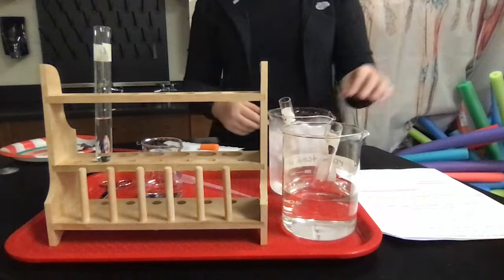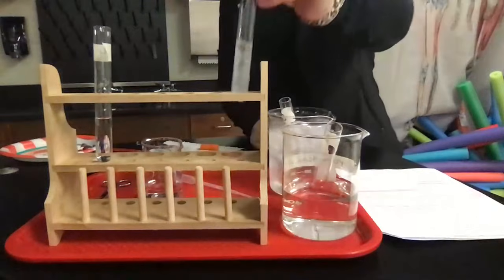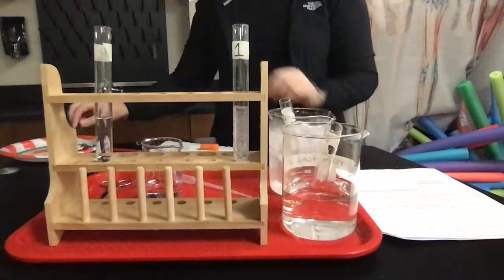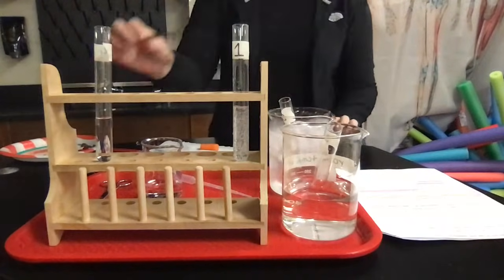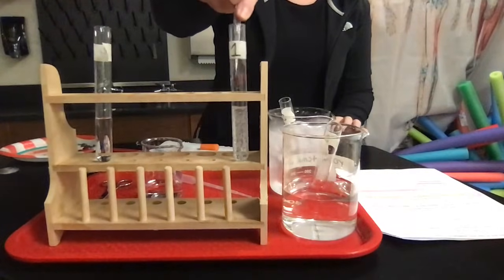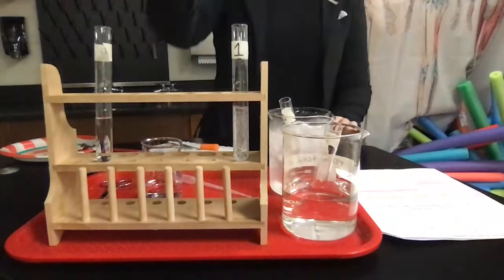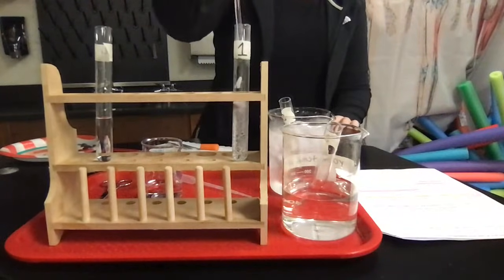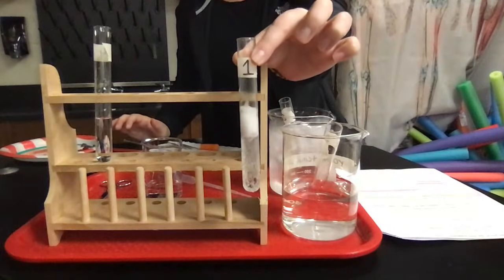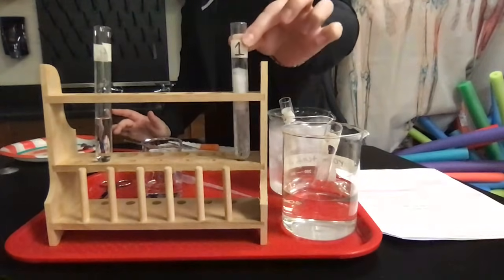So I'm going to go ahead and pull my test tubes out, and I'm going to do them kind of one at a time for you. So this first one was placed into physiological temperature. That's our hot water bath. It's roughly 37 degrees Celsius, which is physiological temperature. That's like 98.6 degrees Fahrenheit, which is your body temperature. And theoretically, that's where you should see your enzymes working the best, because that's where they're found naturally. Okay, so the wood's a little bit in the way here, but we have a reaction proceeding here. So this is at the physiological temperature, roughly 37 degrees Celsius. So I'm going to leave that one here.